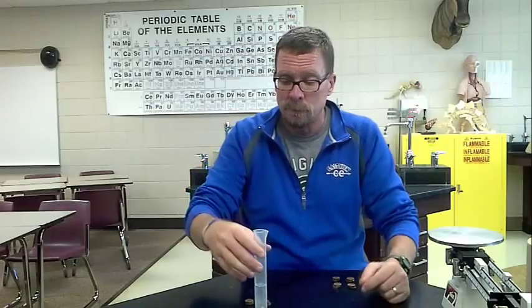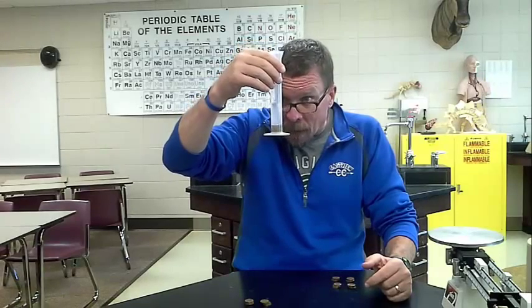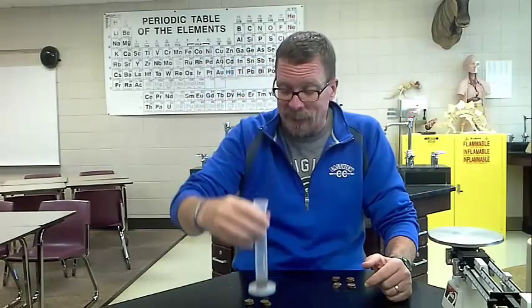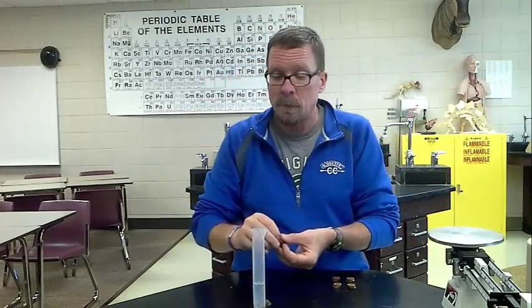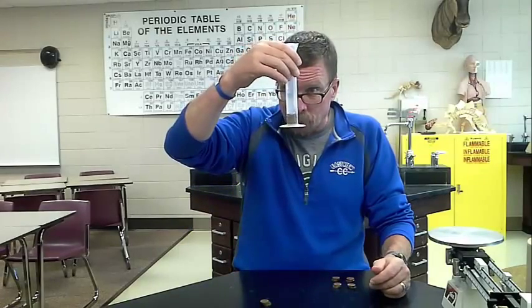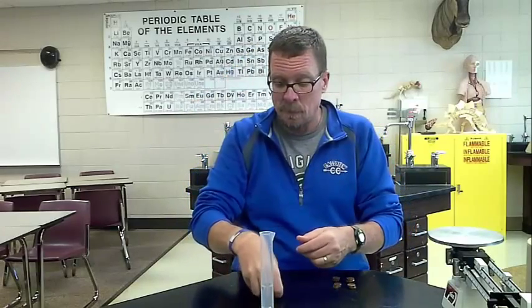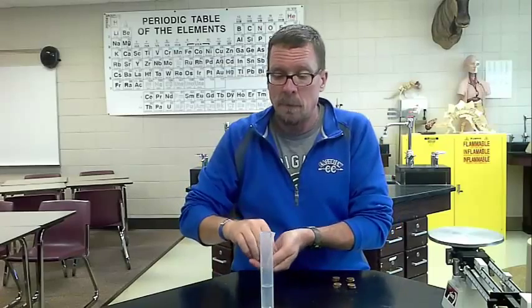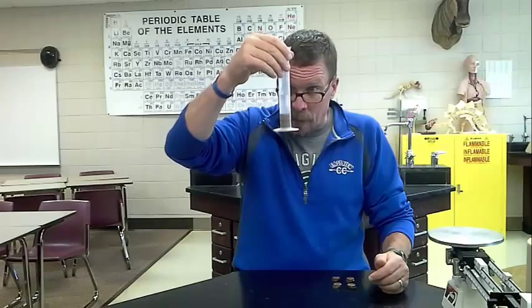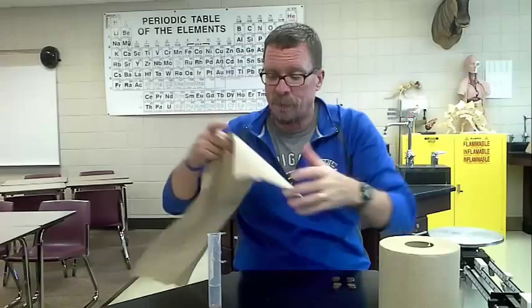5 more. I'm going to call that 24.8. 5 more. I'm at 26. And the final 5. And I'm at 28 milliliters. And of course, all that will be recorded in my data table.